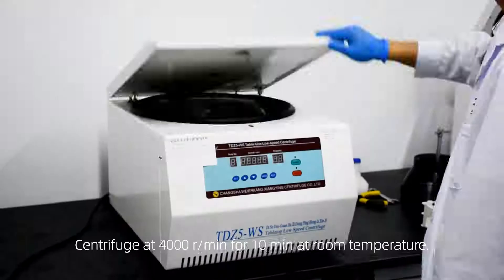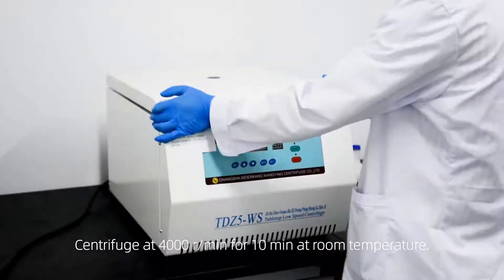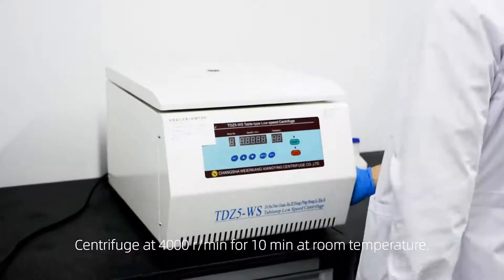Centrifuge at 4000 revolutions per minute for 10 minutes at room temperature.